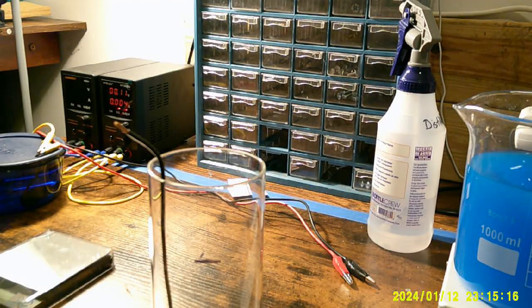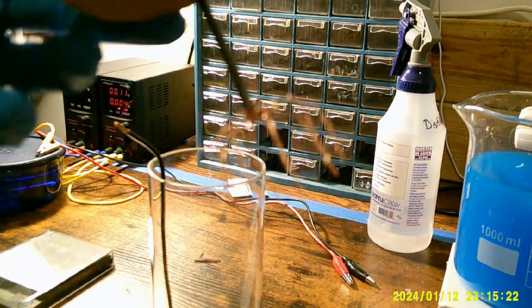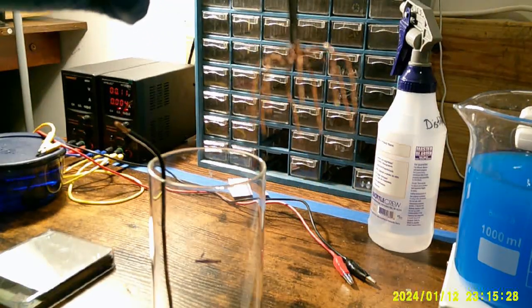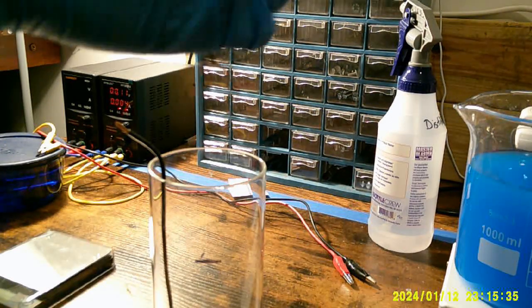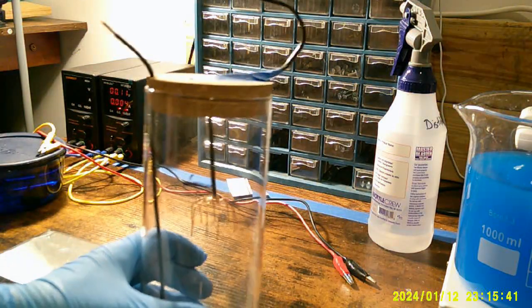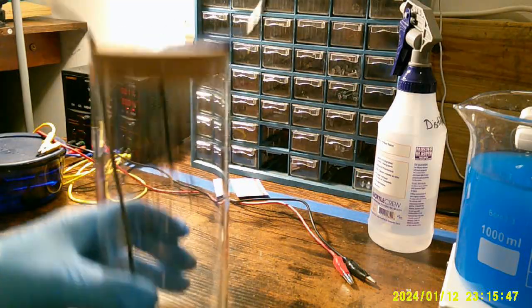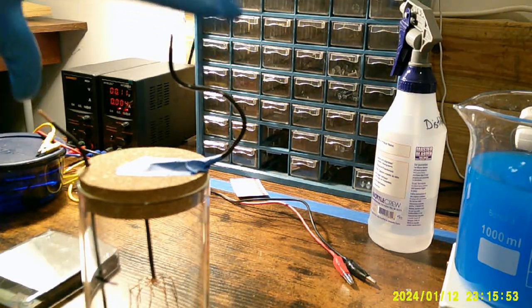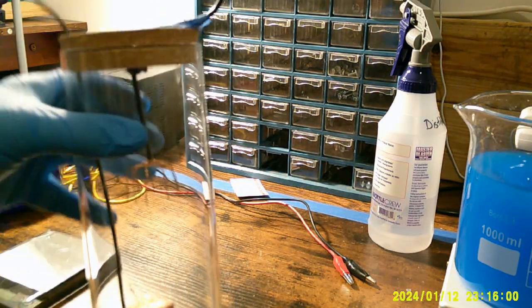And then I take a wire that has been molded into an interesting shape. I don't know how well you can see that. I created a kind of a chandelier effect. And what I'll end up doing is this. So now what I have is the cathode where the crystals will grow is up on top and in the middle. The anode is down on the bottom. And I connect the two wires to these two right here. So that is going to be the setup.